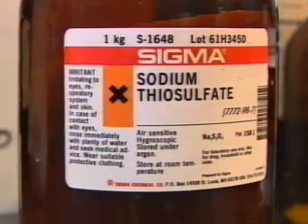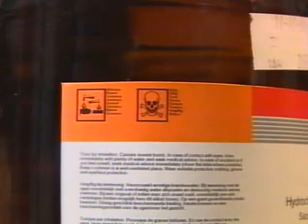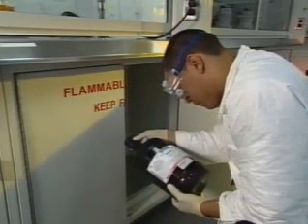And those labels are great. They tell you everything. Like if a chemical is a poison, if it is flammable, explosive, corrosive, everything. Yeah, it's important to know how to read those labels, and not to use chemicals that aren't labeled. Just look at the technique these kids are using when handling chemicals. Watch this guy. See how he checks the label twice.